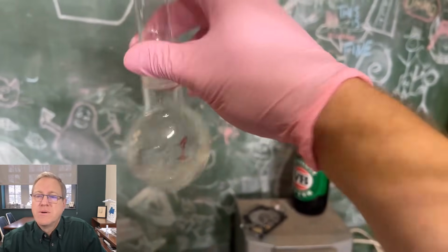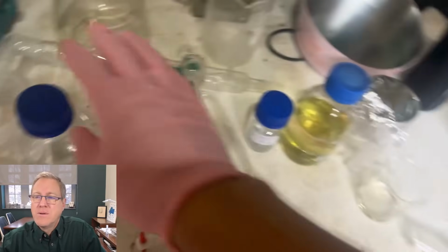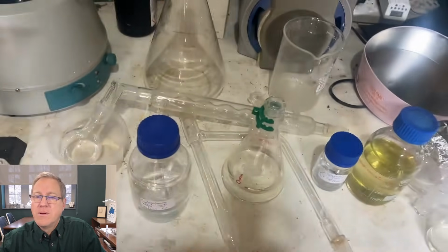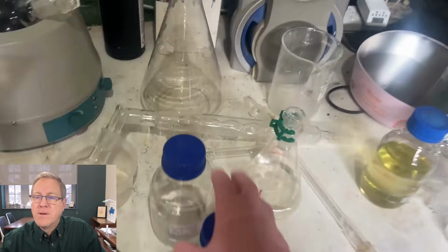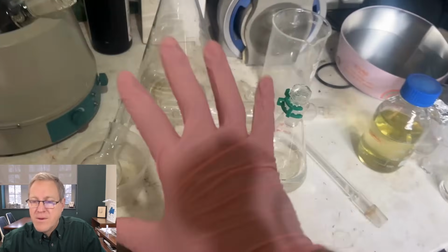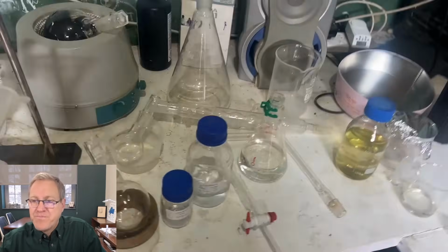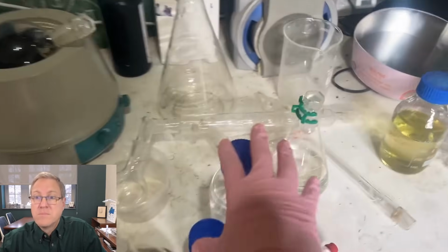Well, I could try and boil the toluene out of it, but for the sake of purity, we're kind of left here with our 46% yield. If we combine it with our previous synthesized stuff from September 2020, together we have about 150 grams, which is quite a bit to go on with, because we want to convert all this into the tribromo, which is the next step.